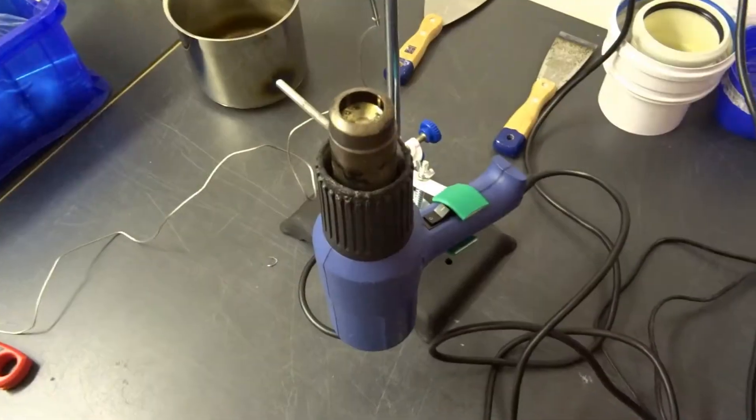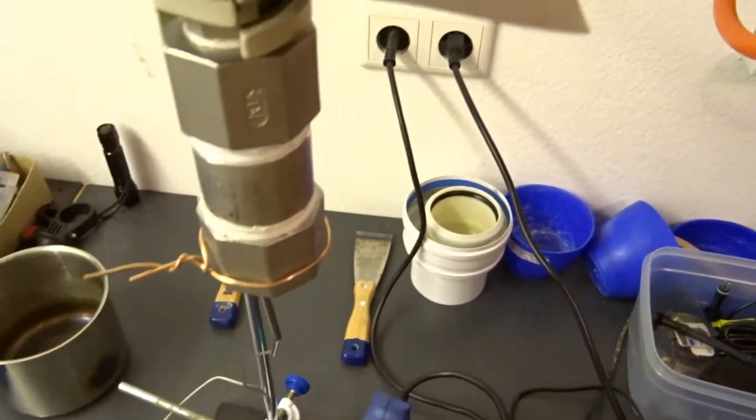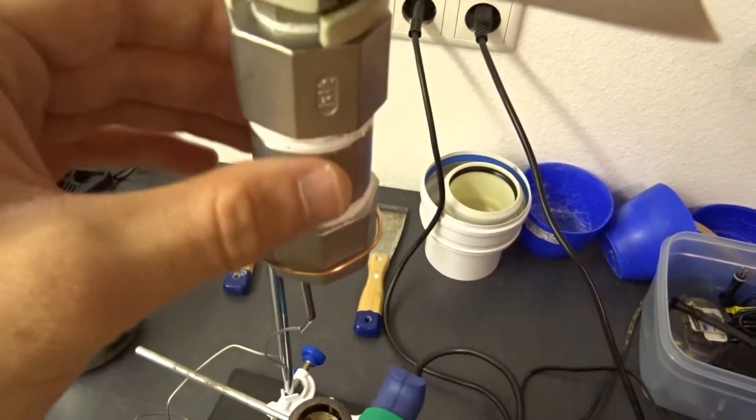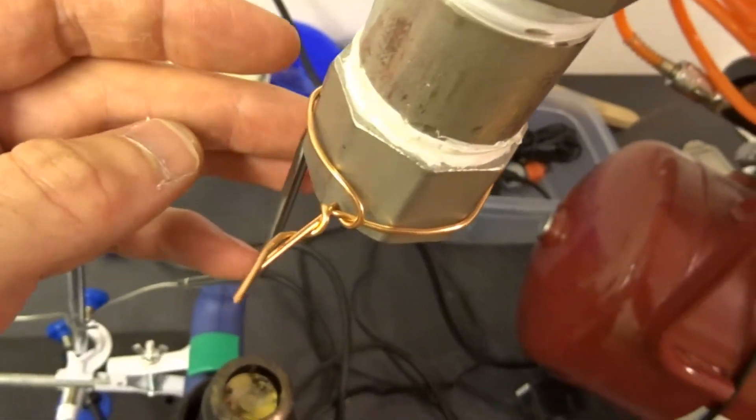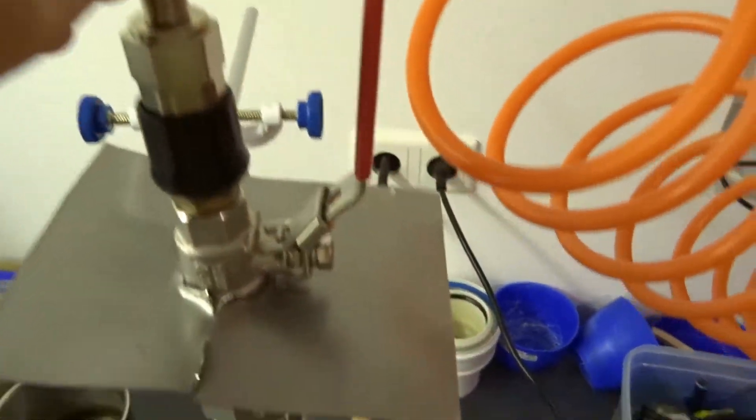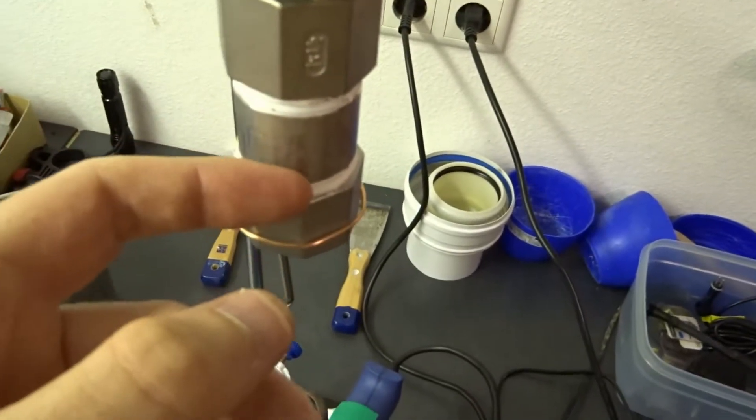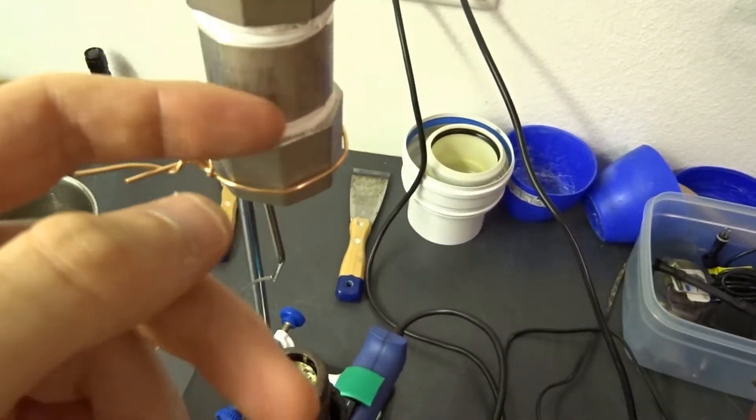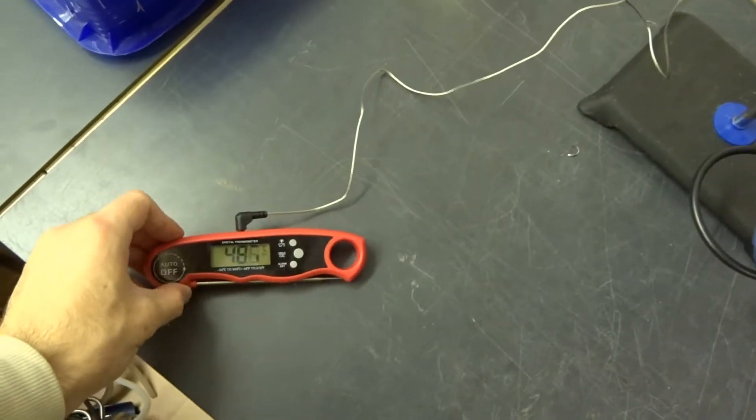So let me set this up. It's all set up now. I've connected it, I've interlocked the tubes, I've screwed them together, added the thermometer, opened the valve and I have seven bars of pressure. This should prevent any water bubbles from forming. And of course I have the thermometer hooked up.